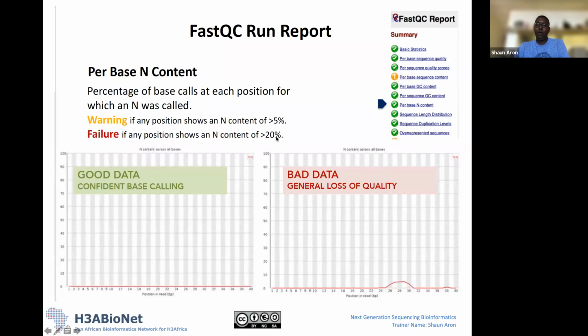So again, you can be very strict, or you can be more lenient, depending on whether you want to save your data set or not. But essentially, if you look at any data set and it's got lots of N's in it, I would just chuck that data set out. This one, I would say it's acceptable. I would still run with this data set. But if you see N content greater than 20%, then maybe it's not worthwhile, and something strange probably happened with this data set, so we might as well chuck it out. You can decide what your cutoffs are and how liberal or strict you want to be with N content.